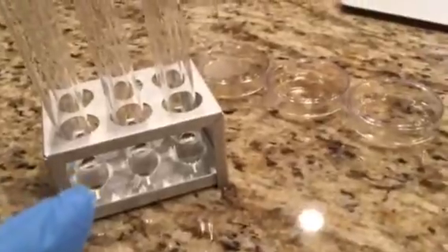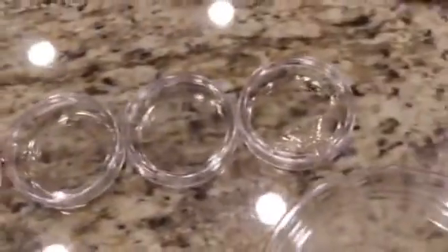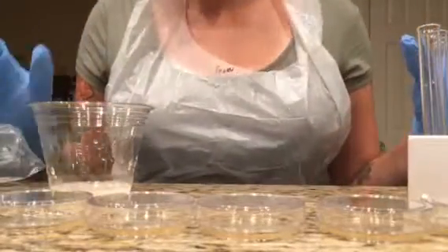So to start off, I have all of the 6 tubes filled up with 2.25 milliliters of distilled water. They are all labeled. And then I also have the 6 Petri dishes already set and ready to go. And I also have the yeast solution already made and ready to be dispersed into the tubes. So I'm going to go step by step on what is explained within our lab experiment.